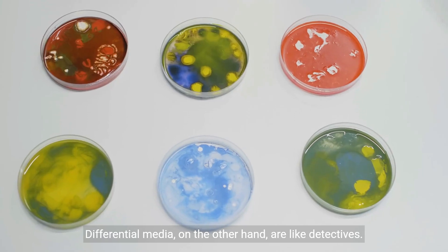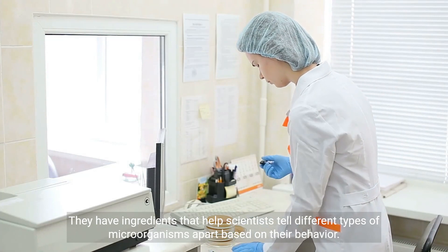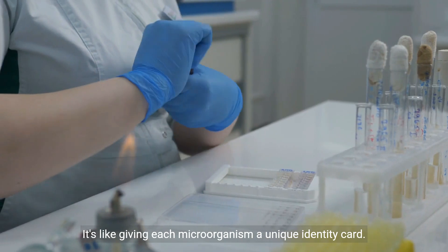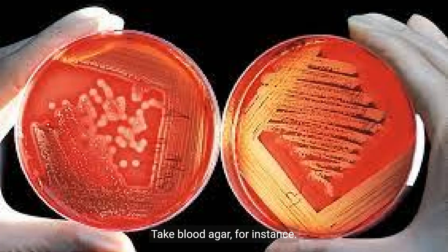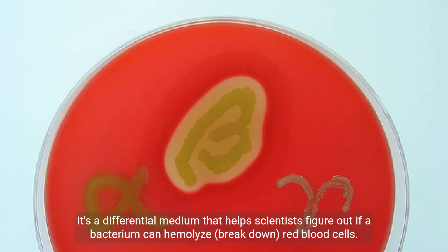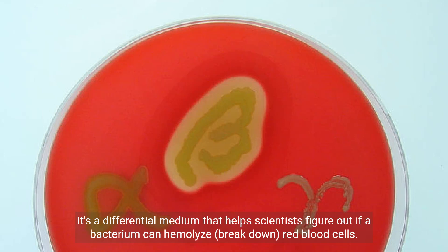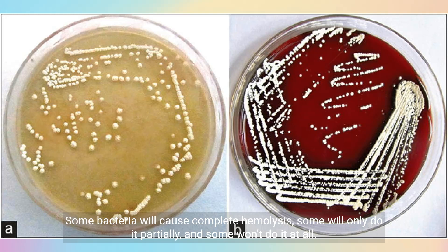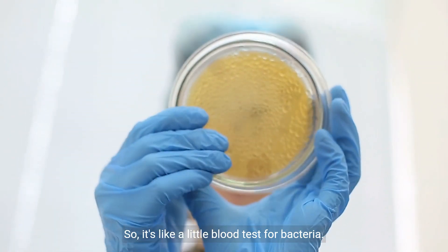Differential media, on the other hand, are like detectives. They have ingredients that help scientists tell different types of microorganisms apart based on their behavior — giving each microorganism a unique identity card. Take blood agar, for instance. It's a differential medium that helps scientists figure out if a bacterium can hemolyze, or break down, red blood cells. Some bacteria will cause complete hemolysis, some will only do it partially, and some won't do it at all — it's like a little blood test for bacteria.